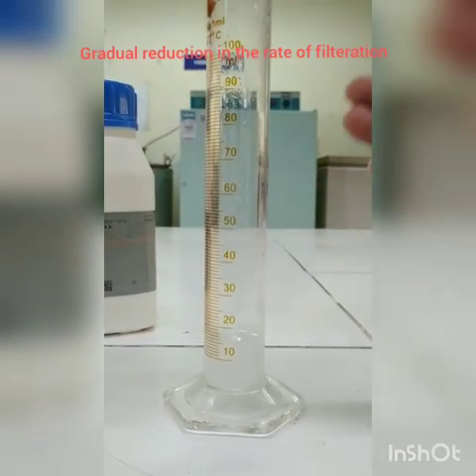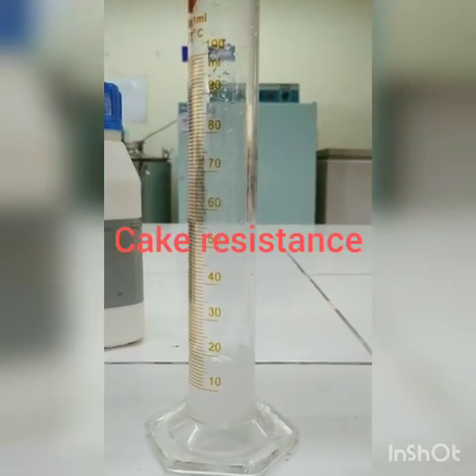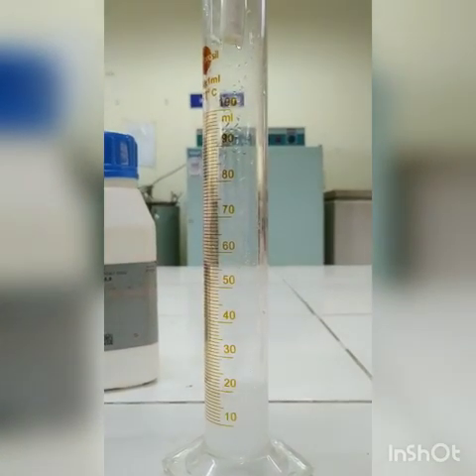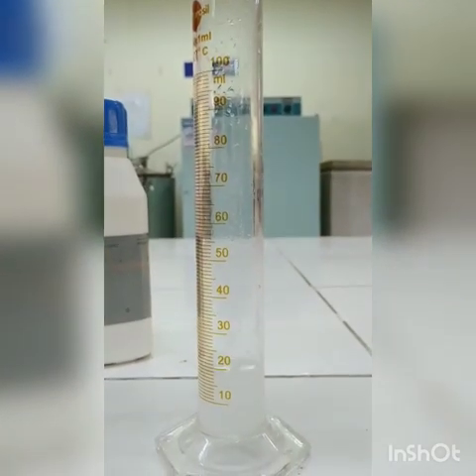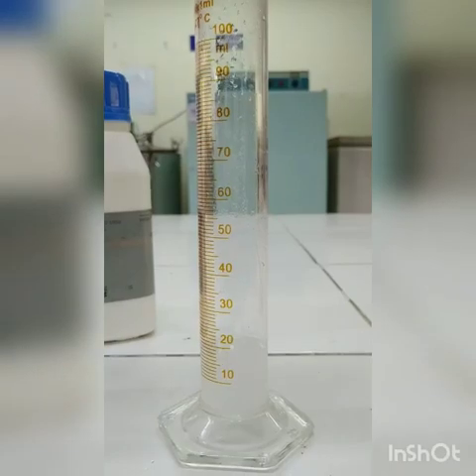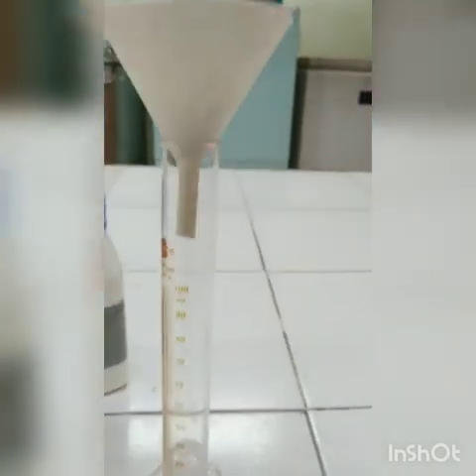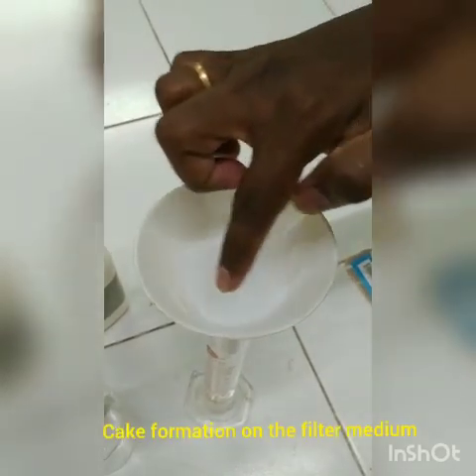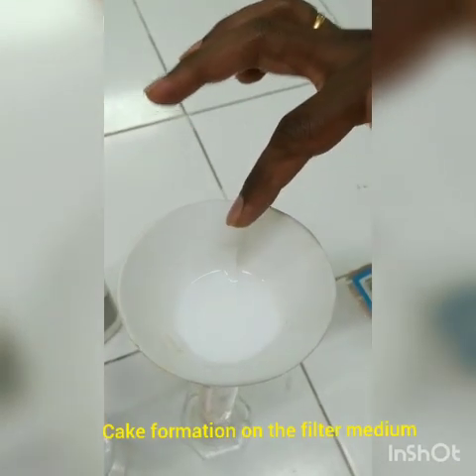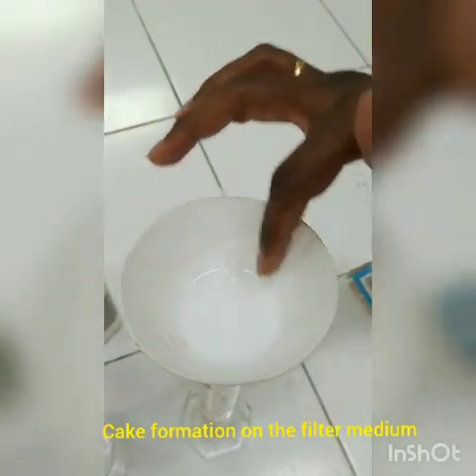This reduction in the filtrate collection is due to the cake resistance. What is cake resistance? The resistance offered by the particles that are present in the filter medium to resist the filtration. Let us see what happened at the top of the funnel. You can see after being added, slowly the calcium carbonate started to precipitate over the filter medium. So it clogs the filtration pores.